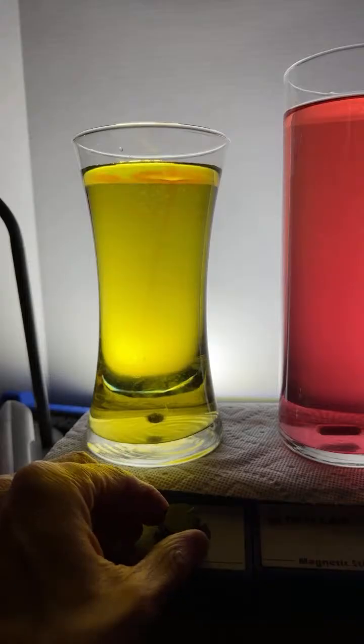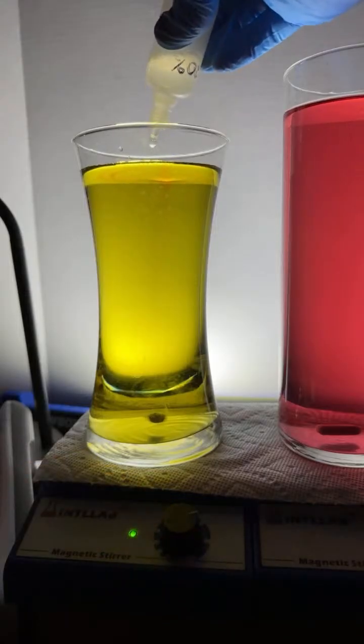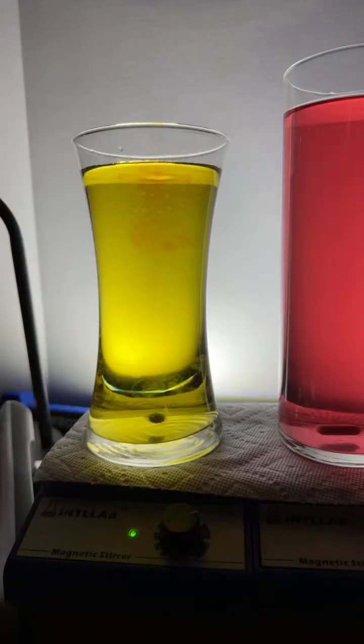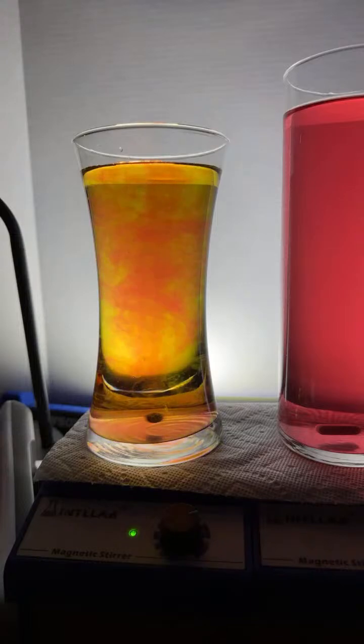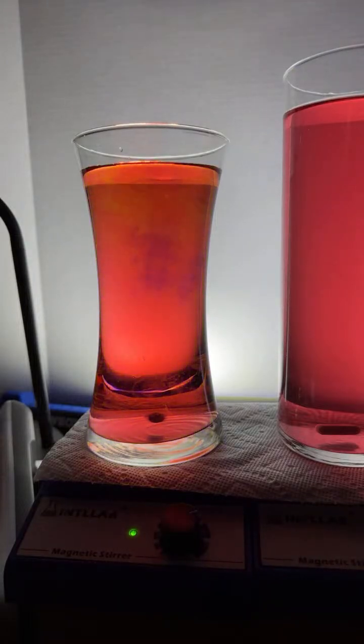Angelina, I'm just doing the reaction with universal indicator. I did it in class for you guys. I'm just adding acid or base to universal indicator, so we're changing the pH. And Angelina, I'm adding sodium hydroxide, one of the strong bases. Here, let's add a drop over here. Drop of sodium hydroxide for Angelina. Oh, nope, I lied to you. That's hydrochloric acid, one of the strong acids. I messed up. That's not the first time Angelina's seen me mess up.